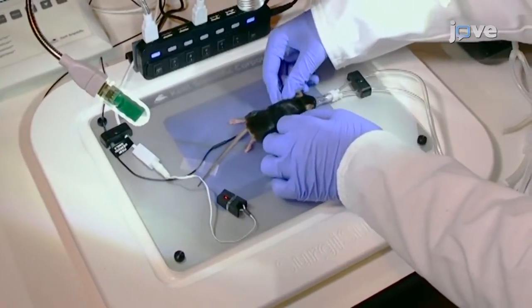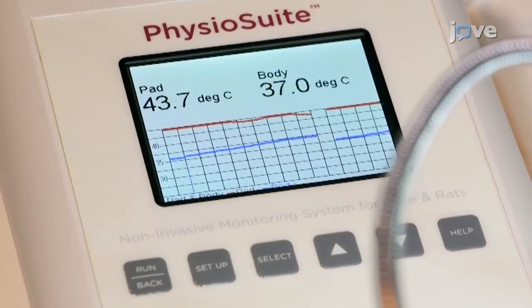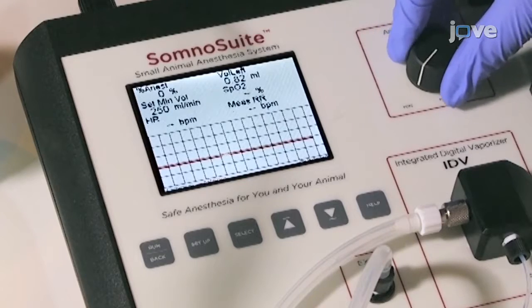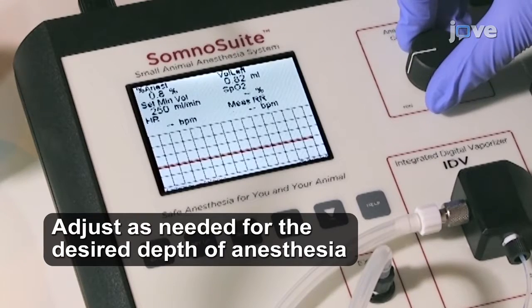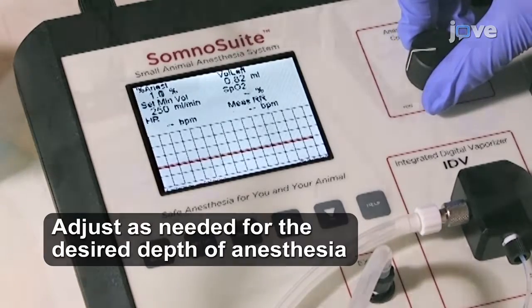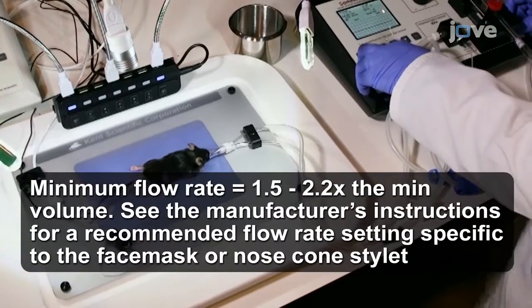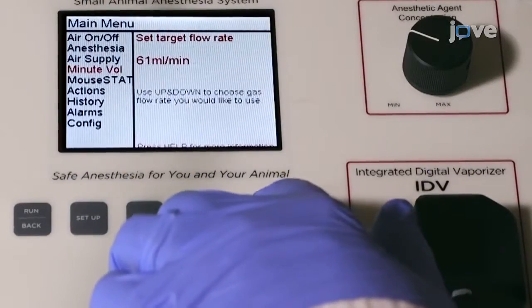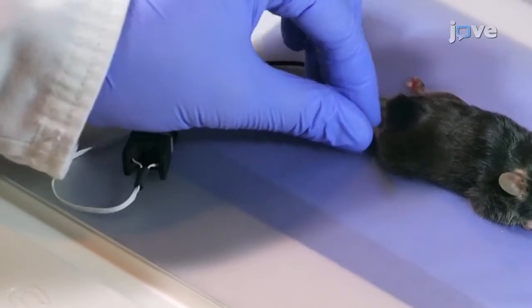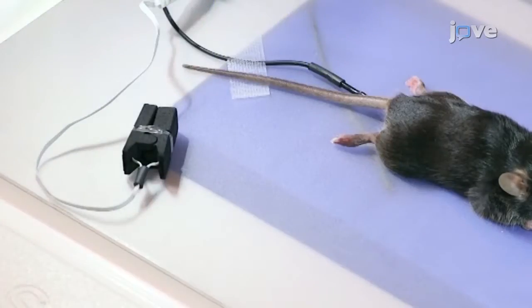Next, center the animal on an infrared warming pad set to maintain body temperature at 37 degrees Celsius via a rectal probe on a feedback loop. With the mouse positioned on the nose cone, adjust the concentration of isoflurane to 1.5%. Now, reduce the minute volume to support anesthetic maintenance. Confirm the depth of anesthesia as determined by a lack of withdrawal reflex during an interdigital pinch.